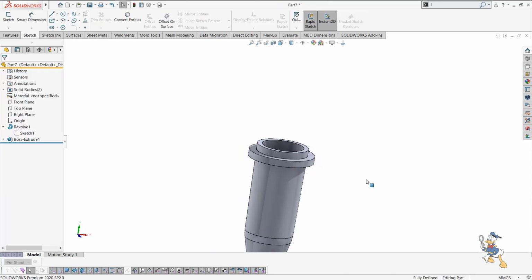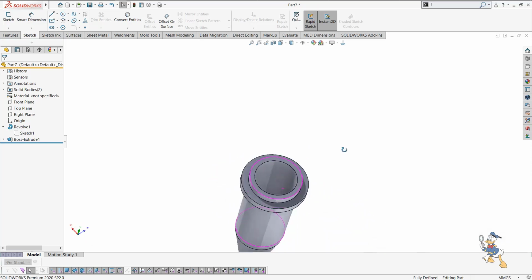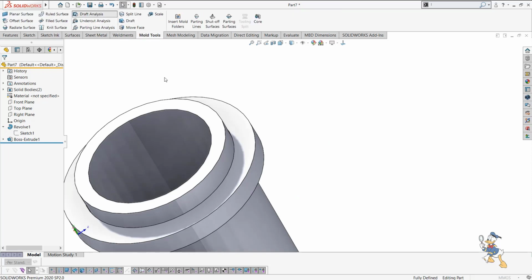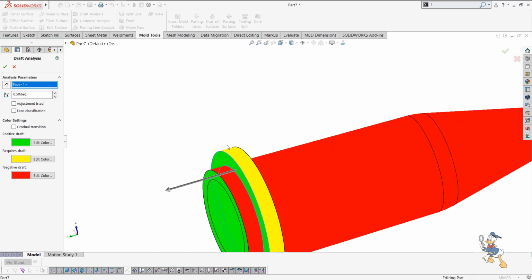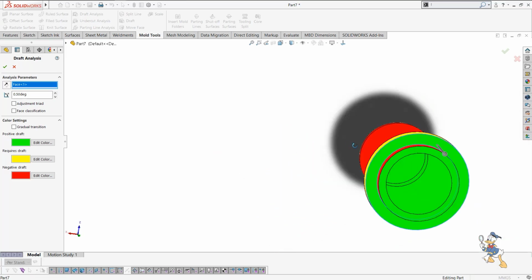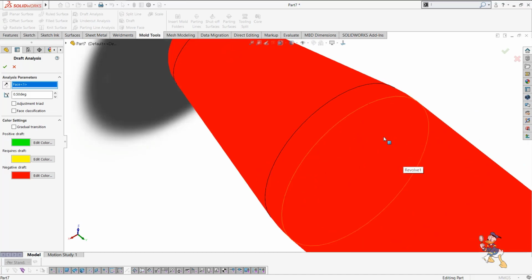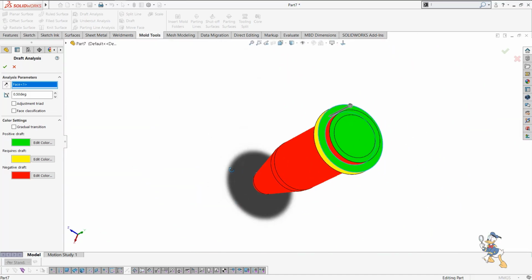This is how we can generate a plastic cap over here. So this is some sort of tube of 1.5 mm. Suppose we just need to check out the draft analysis for this feature. We can check out the draft analysis. It is showing that this one is the only feature which is without draft, at 0 degrees. Otherwise every feature has a draft value, and by moving the cursor on the face, it automatically shows the draft value.